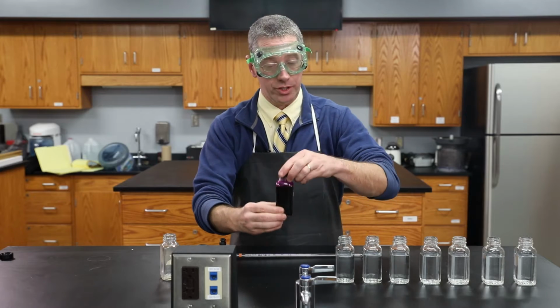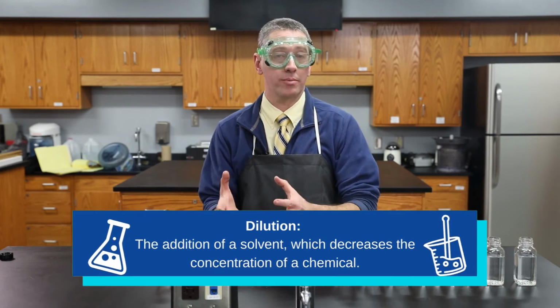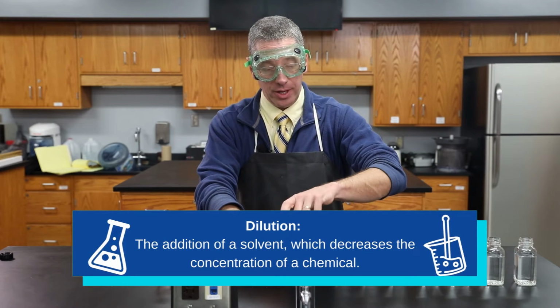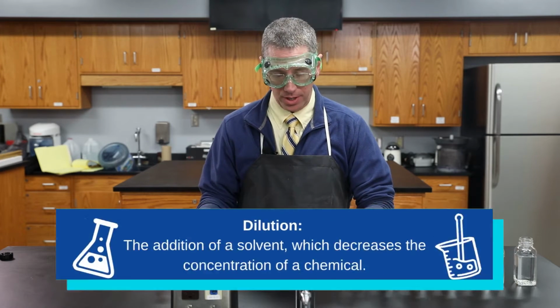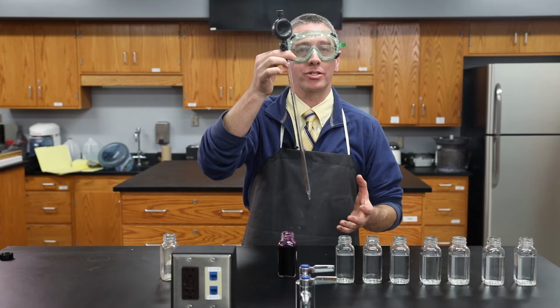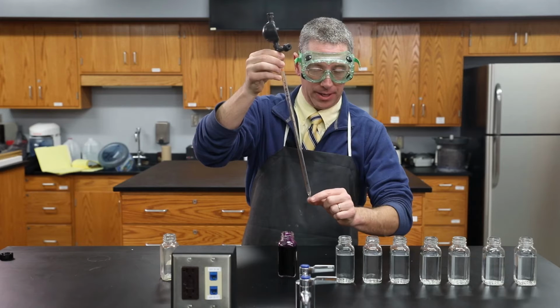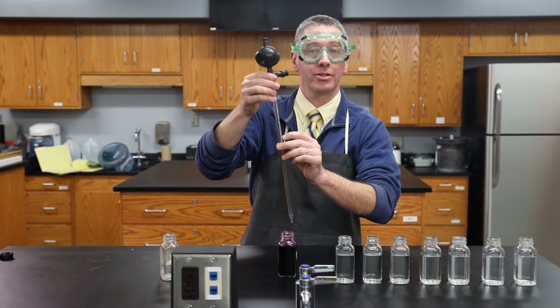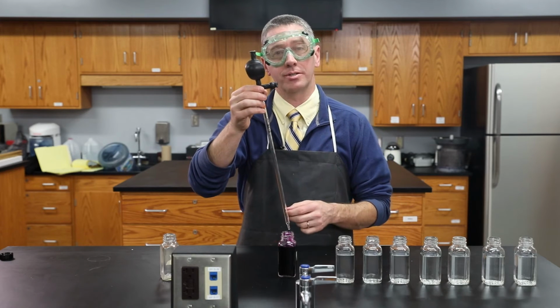Now, another useful skill in chemistry is diluting chemicals. In other words, taking a stronger chemical and watering it down to make it weaker. To do that, oftentimes you need to make very precise measurements of your volume. And you can use a pipette to do that. This is basically a graduated cylinder, like a straw. And I can place it into the potassium permanganate and withdraw exactly 10 milliliters, and it's graduated to the 1/10 of a milliliter. So you can get very precise measurements.